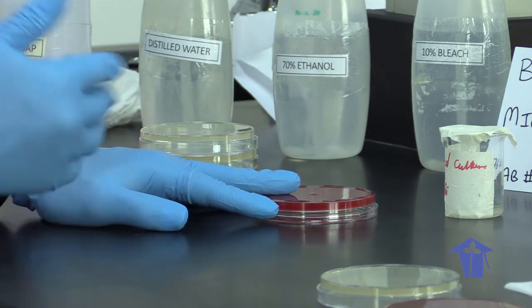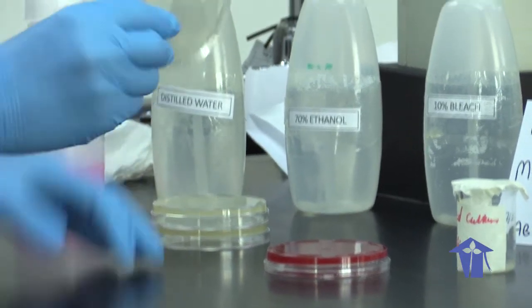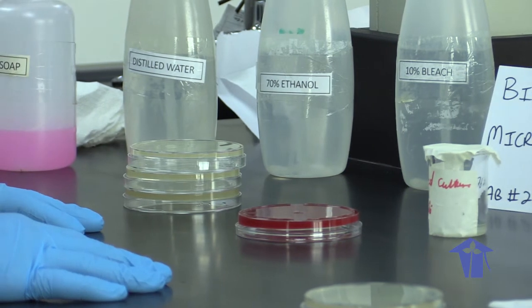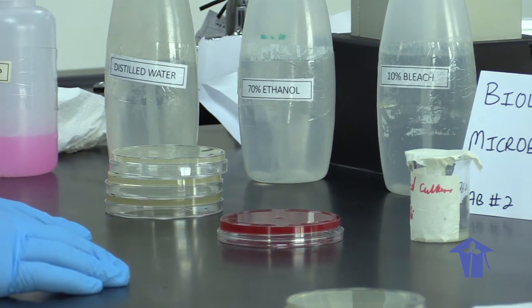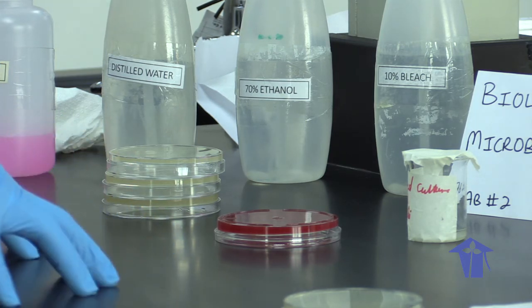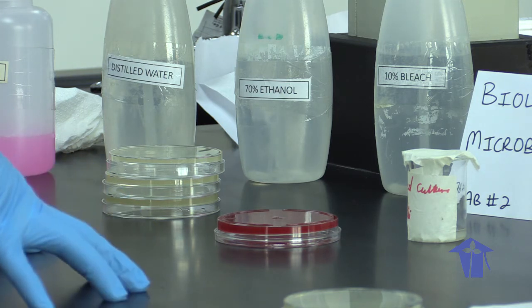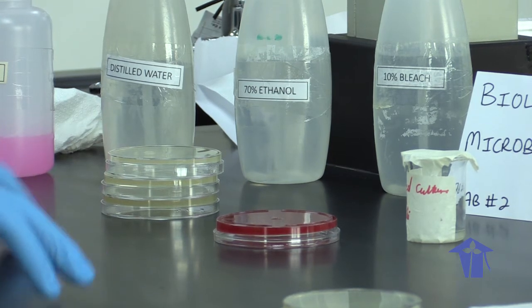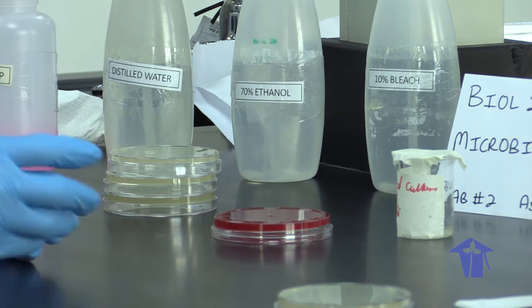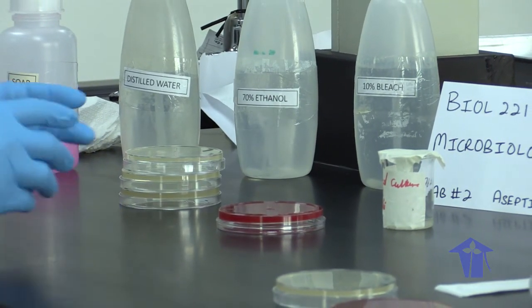The agar can become transparent or can have a slightly greenish hue. Nutrient agar is a straw-colored solid medium. When you introduce your organisms on it, you see little spots known as colonies. They can be varying sizes, varying shapes, varying elevations. We use the morphological description — what they look like on the petri dish — to differentiate between different species on that level.